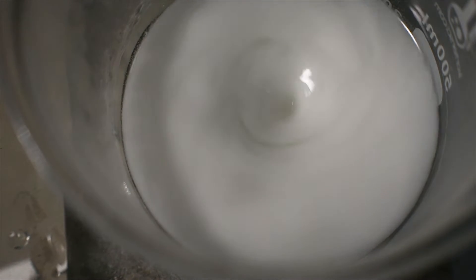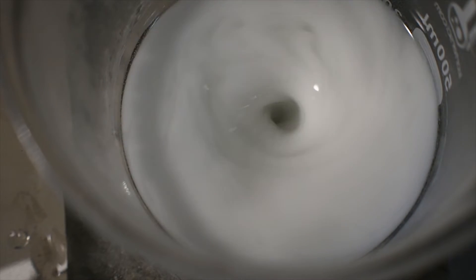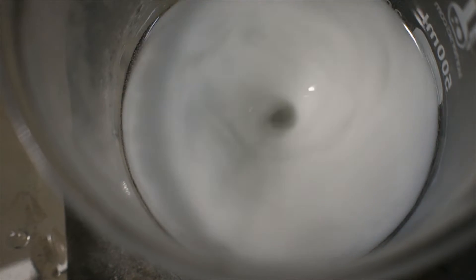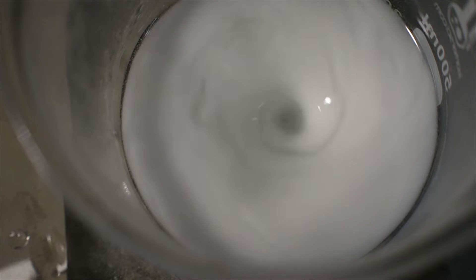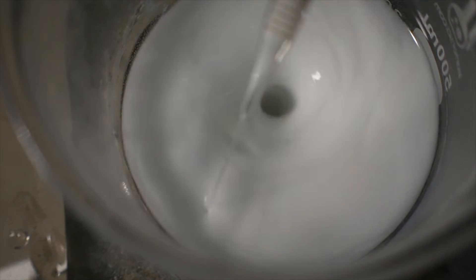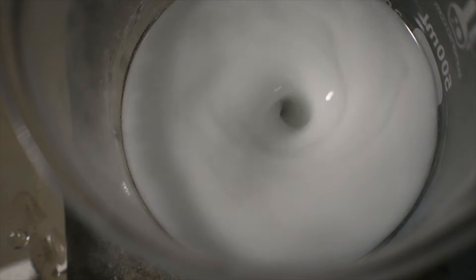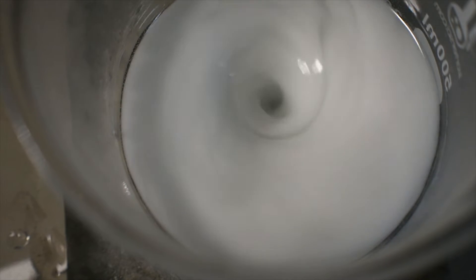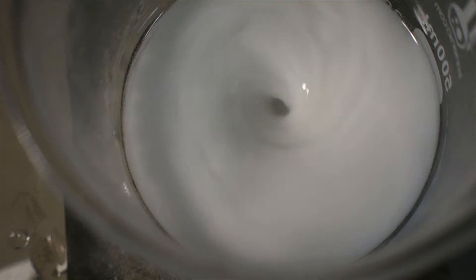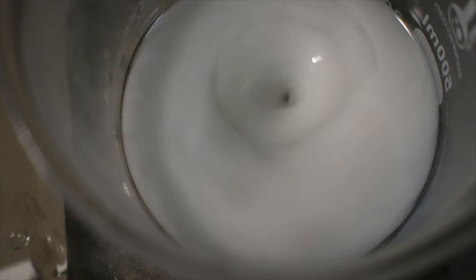You can see that basically all of that tannish/white color is gone, and that's good. We're slightly acidic, so I'm just going to add a further one pipette full of 40% nitric acid and then call it there. Now I'm going to cool this down, add some ice to the water bath to precipitate the product as fully as I can, and then vacuum filter it.